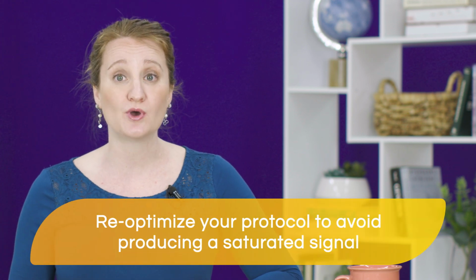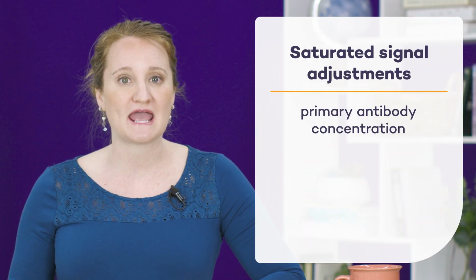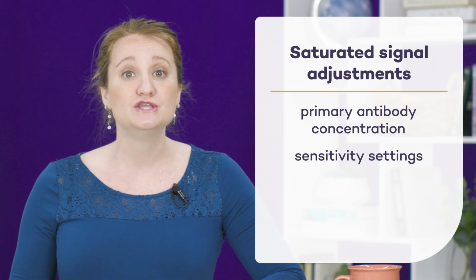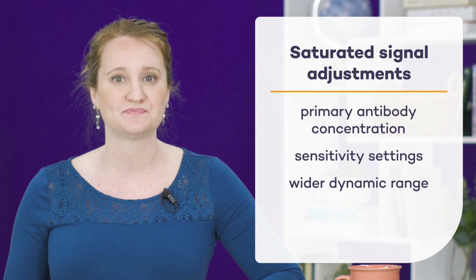When you see that your image contains a saturated signal, either through visual inspection or quantification, you can re-optimize your protocol in order to avoid producing a saturated signal. For example, you can adjust your primary antibody concentration, you can adjust the sensitivity setting on your instrument if necessary, or you can image your membrane using an imager with a wider dynamic range. Because saturated bands cannot be quantified, it's imperative that you take the appropriate measures to avoid them.